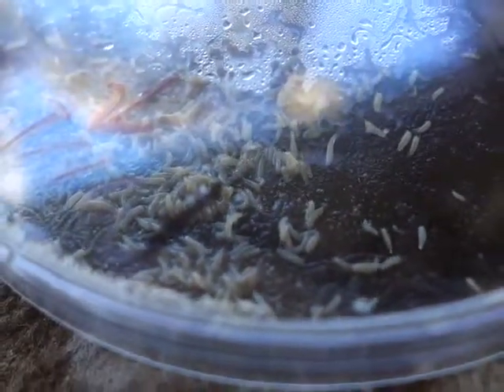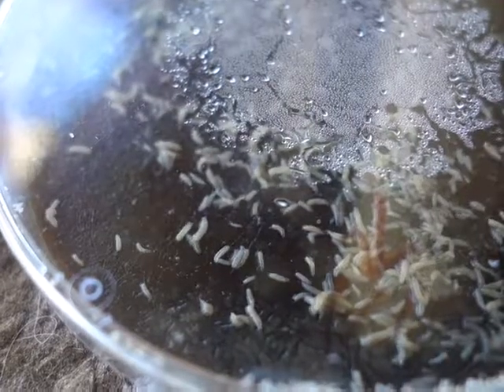And now they're growing. So just to be safe, we're going to kill them.